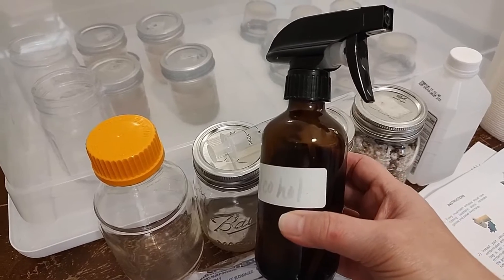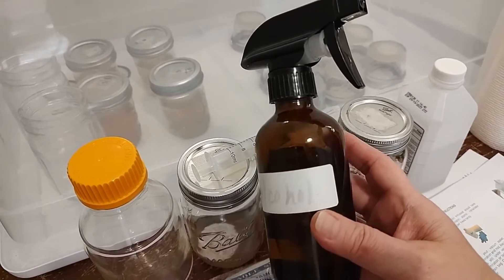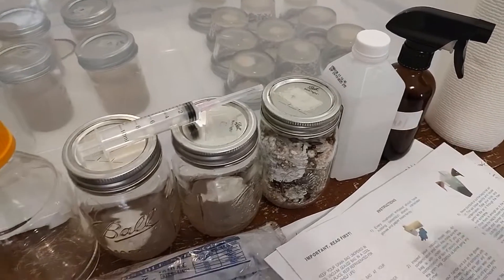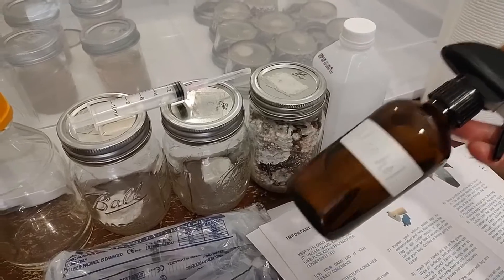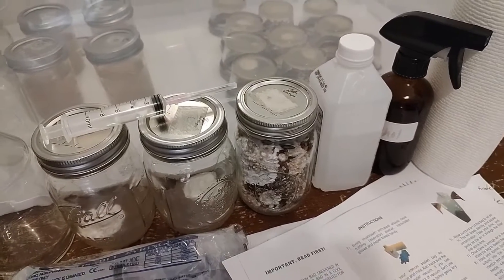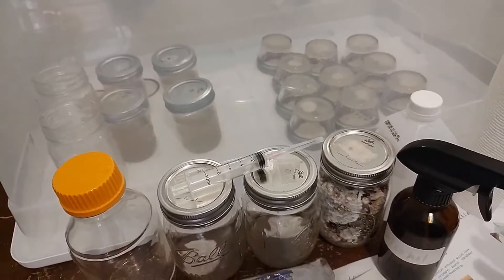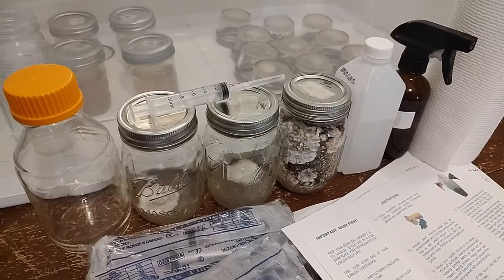Many of you have asked about 70% versus 91% alcohol. If you feel 70% is better, use 70%. If you prefer 91% like we do, you can always add water if needed. A spray bottle makes it really easy, and I also recommend a mister bottle for the fruiting process for your water — so the spray bottle is for sterilization. I use it in every single step. Sterilization and keeping things clean is important. We do use gloves inside the still air box as well — spray everything as you go in and out.